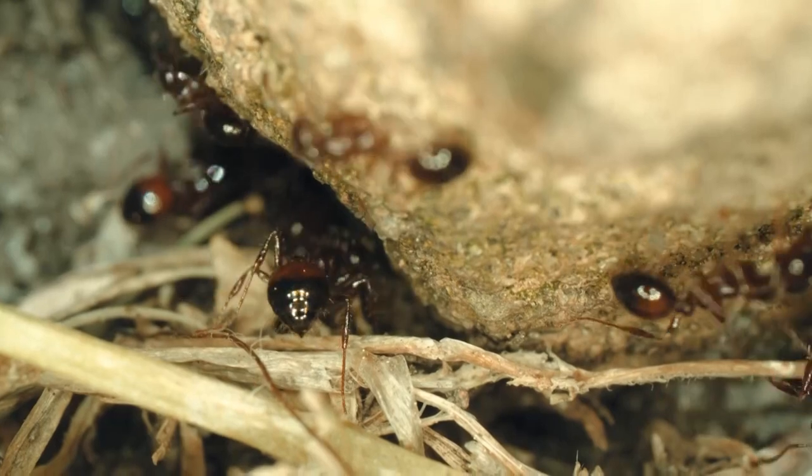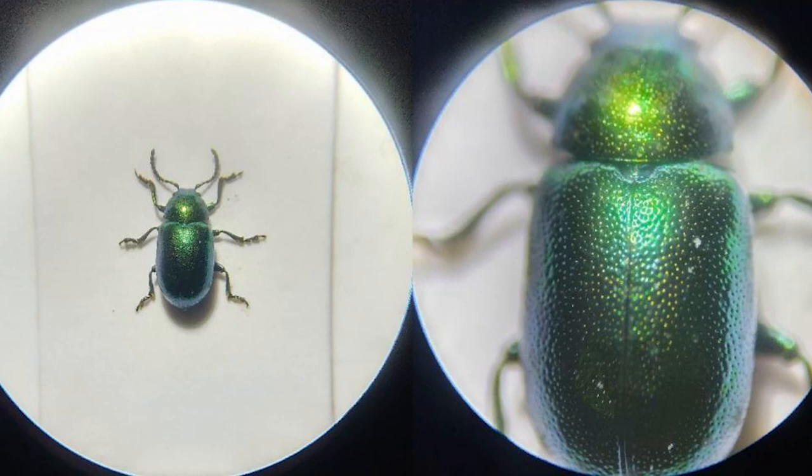Specimens such as insects are very small in size, which is why we need to observe their morphological and visible characteristics using a microscope. For this purpose we use different types of lights and lamps positioned on the right, left, and back sides of the microscope. We do not use light from the bottom, because bottom lighting causes the specimen to appear as a silhouette, making its microscopic characteristics invisible.